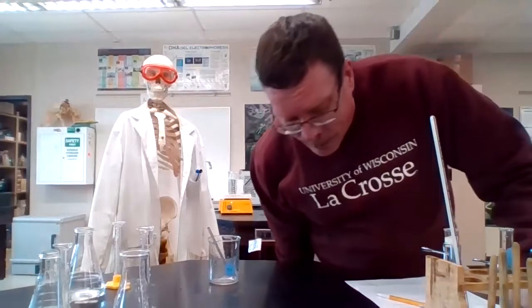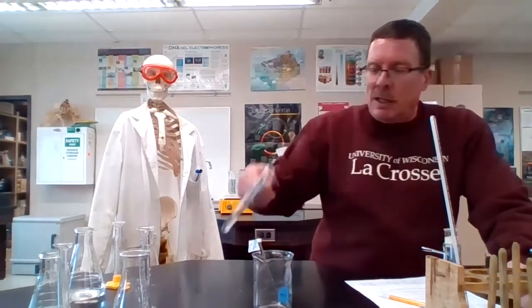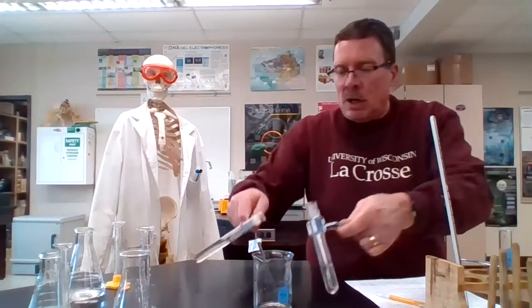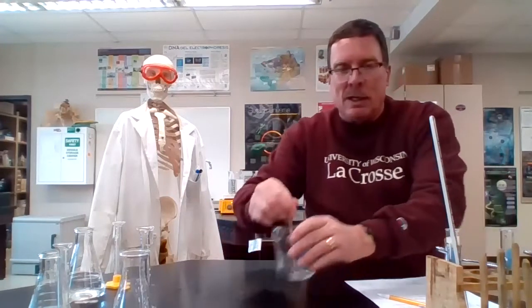Okay, we're back. And now I have taken our stuff. Let me get B in there. And this is the 15 degree mark. So I held it in the bath until we were at 15 degrees. And again, we're going to dump and stir. Hit the timer. Stir it.